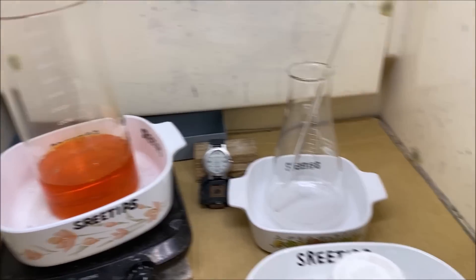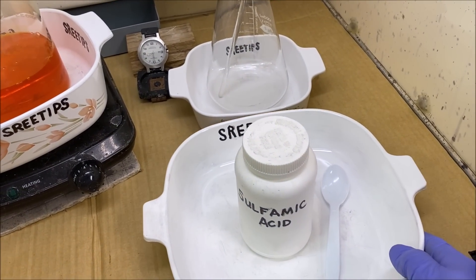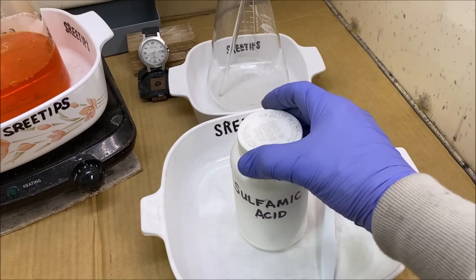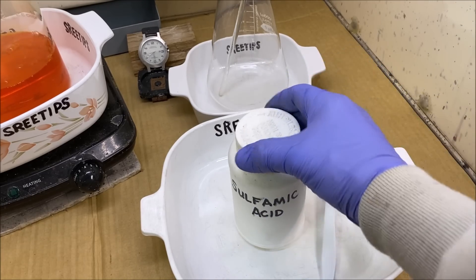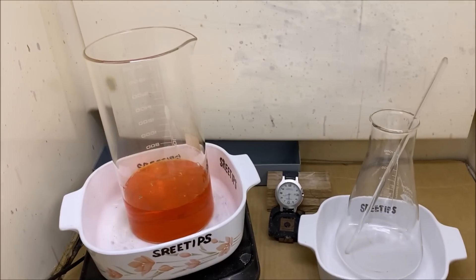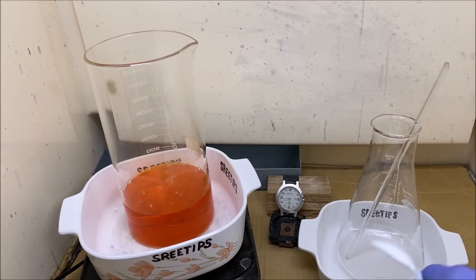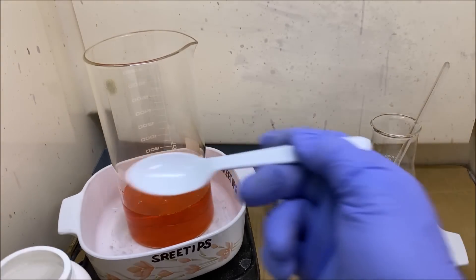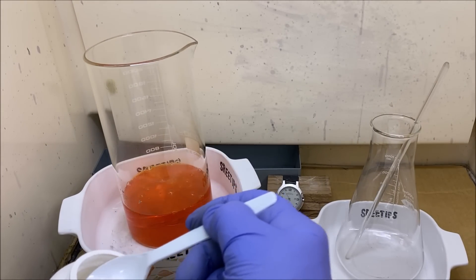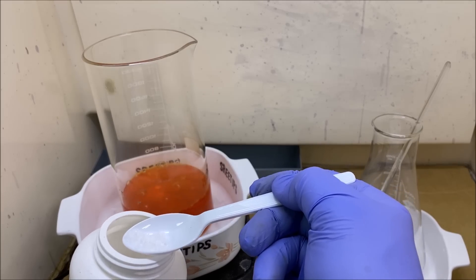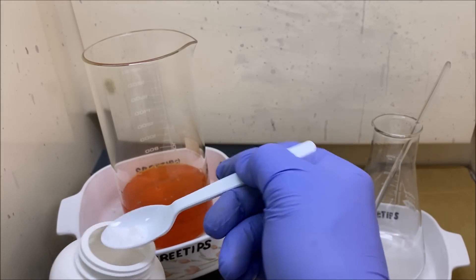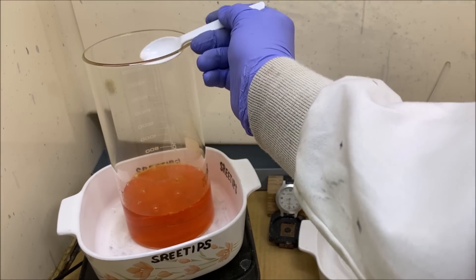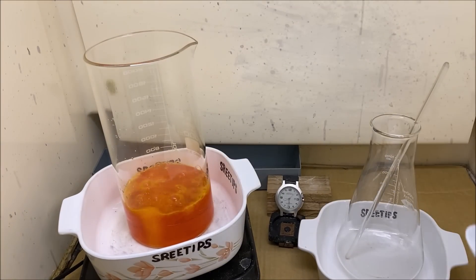However, it takes a long time and I'm trying to get this video posted this evening, Friday evening. So what we're going to do is I'm going to break out the sulfamic acid here and we're going to try an experiment and see if we can denox this gold solution with sulfamic acid. I don't have much experience using sulfamic acid, but the experience I do have dictates caution here because it will bubble up and boil the gold solution over out of the beaker. So I'm adding just very small amounts here to begin with.